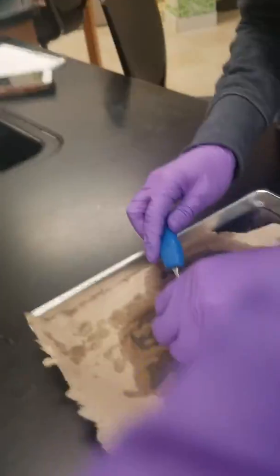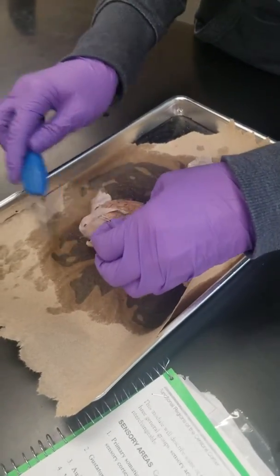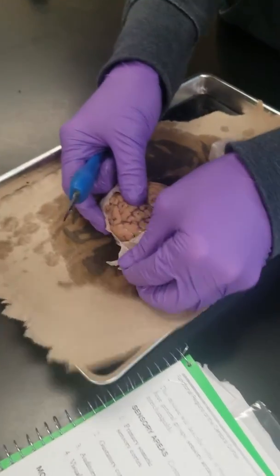Through the dura — pay attention to how it dips in between the cracks. That's going to be something I'll present in the next class period.